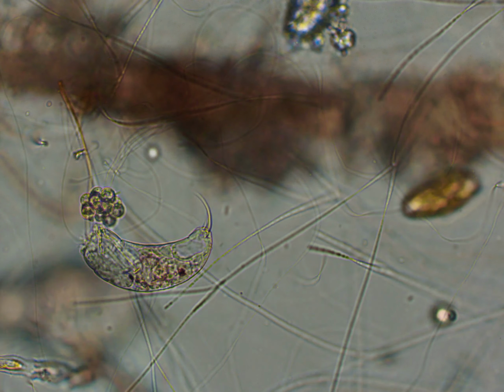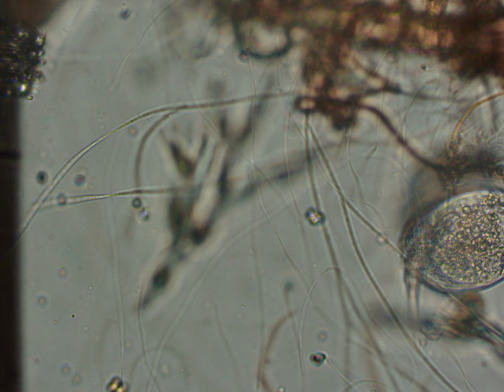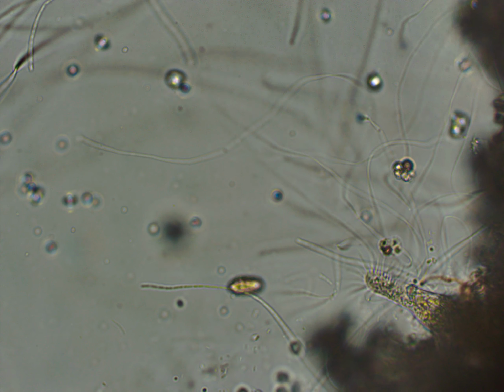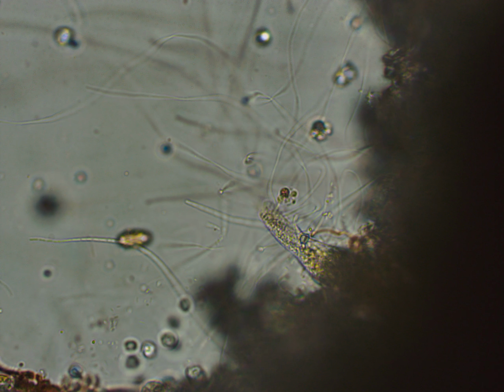They seem to have been here because of all of the other organisms that were here decomposing it and to hunt that bacteria. Their phylum, of course, is Ciliophora, and they are still from Heterotrichida.